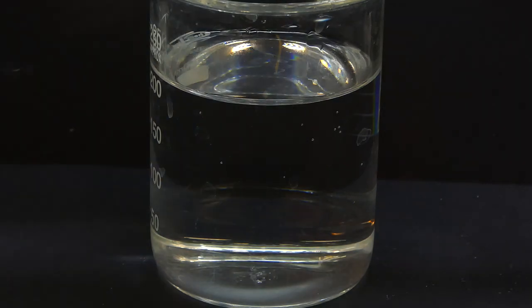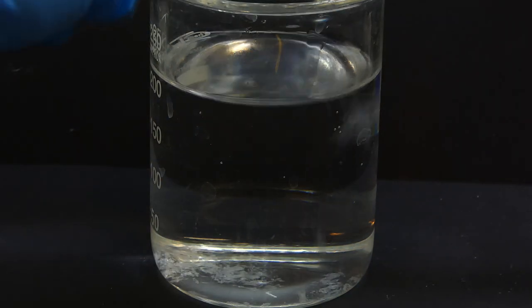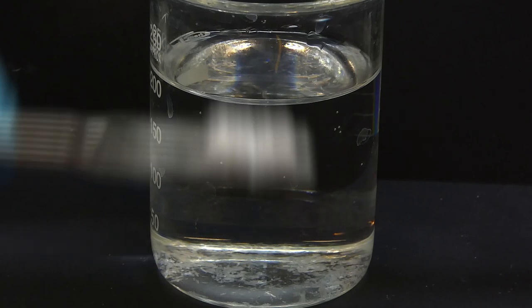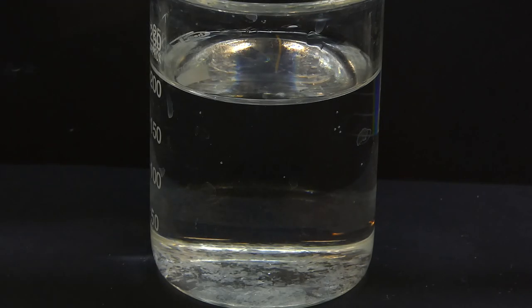If you have everything ready, you can fill a container with the sodium silicate solution and then drop in the crystals. Large crystals will make more thick columns and small bits will make them tall and thin.